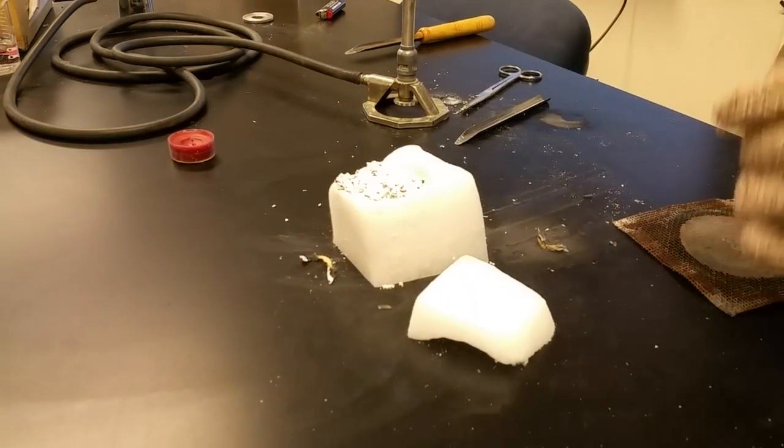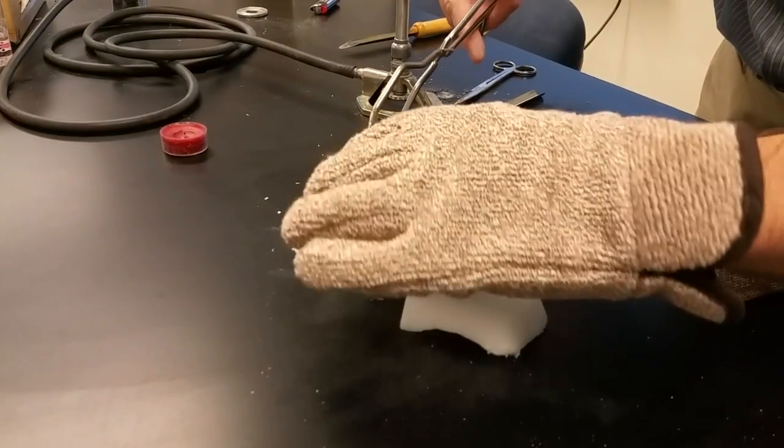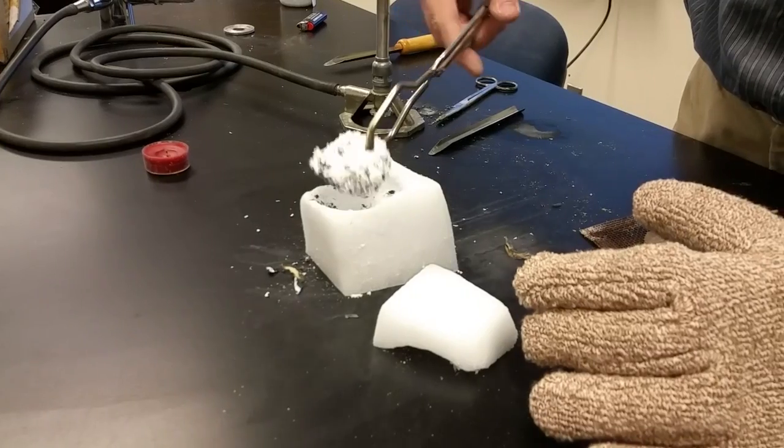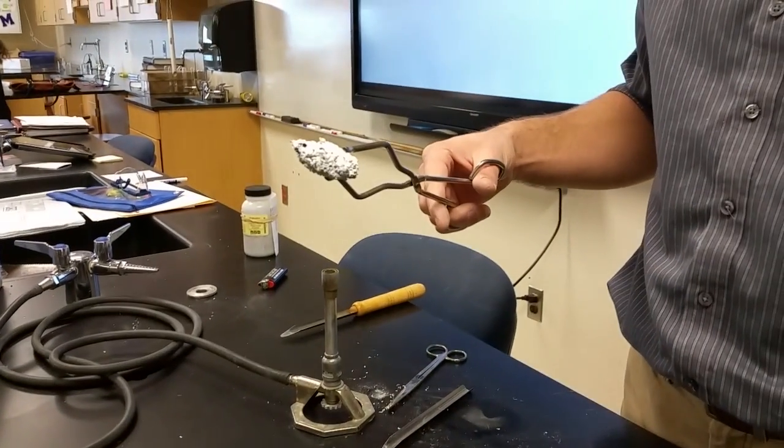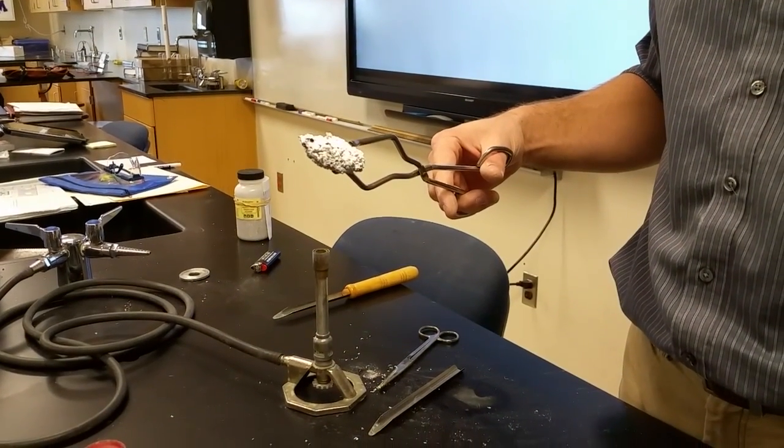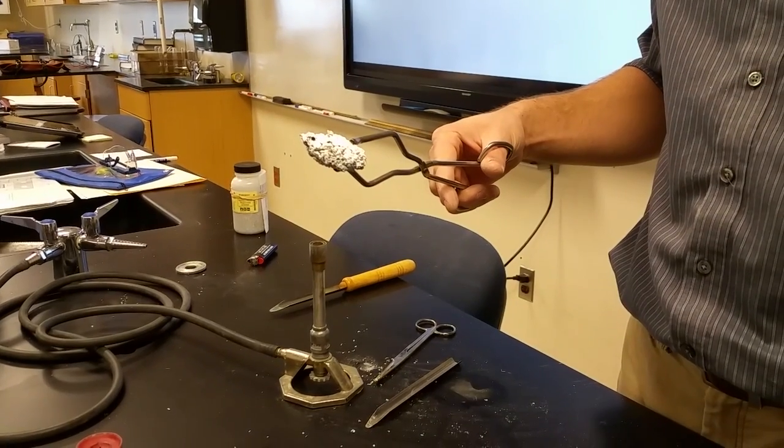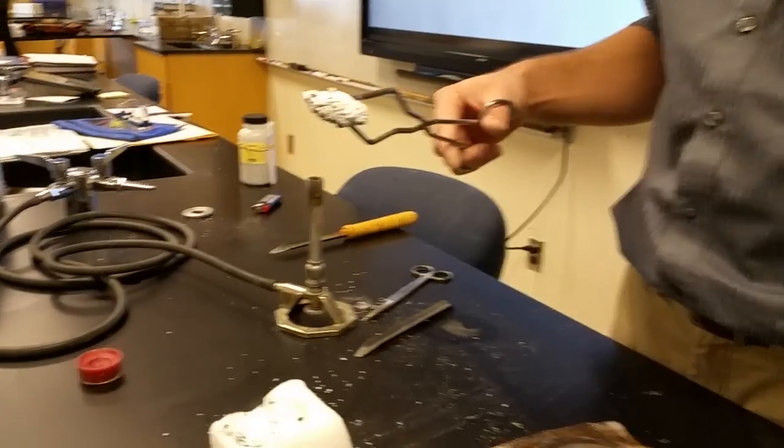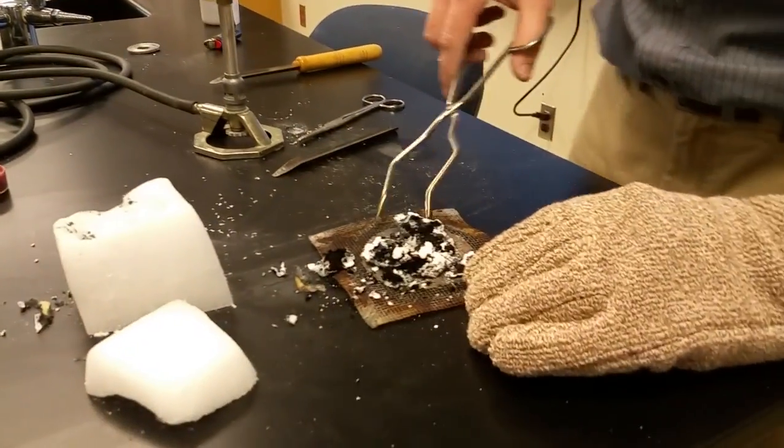So if you take a look, you can see the white powder, which is the magnesium oxide on the outside. And I think they're like, anybody know what zeppoles are? Yeah. Are they like chocolate and covered in powder? Yes. Alright, this is what it looks like, but it's not that at all.